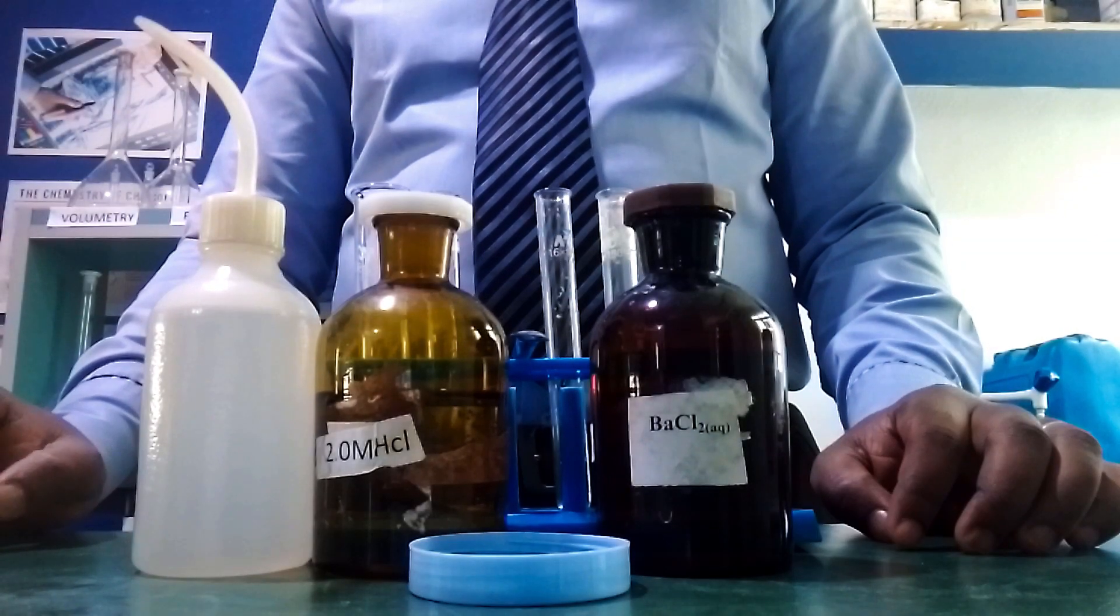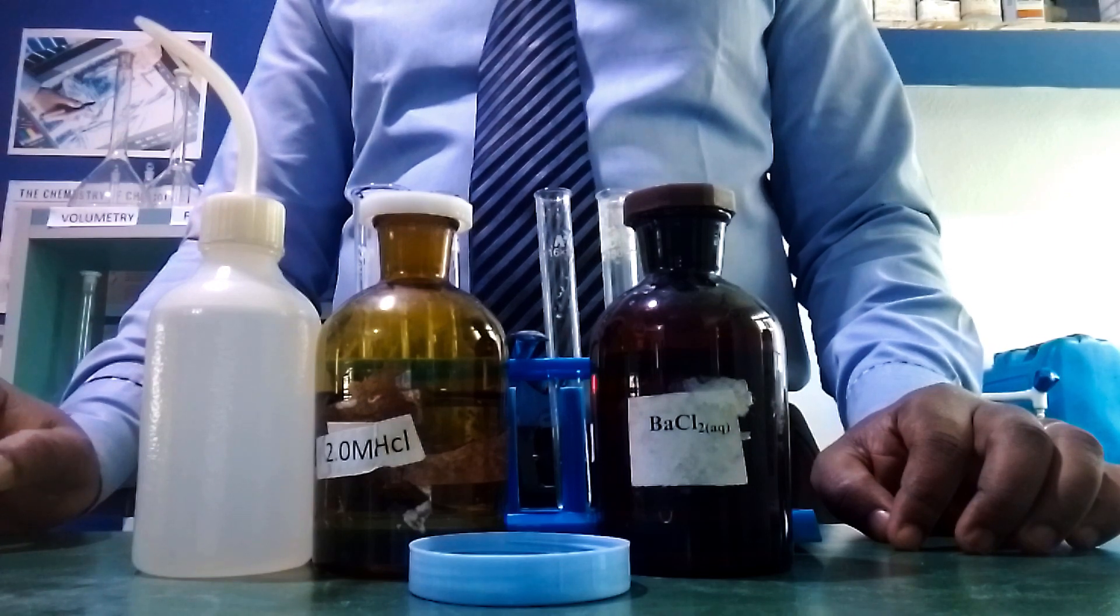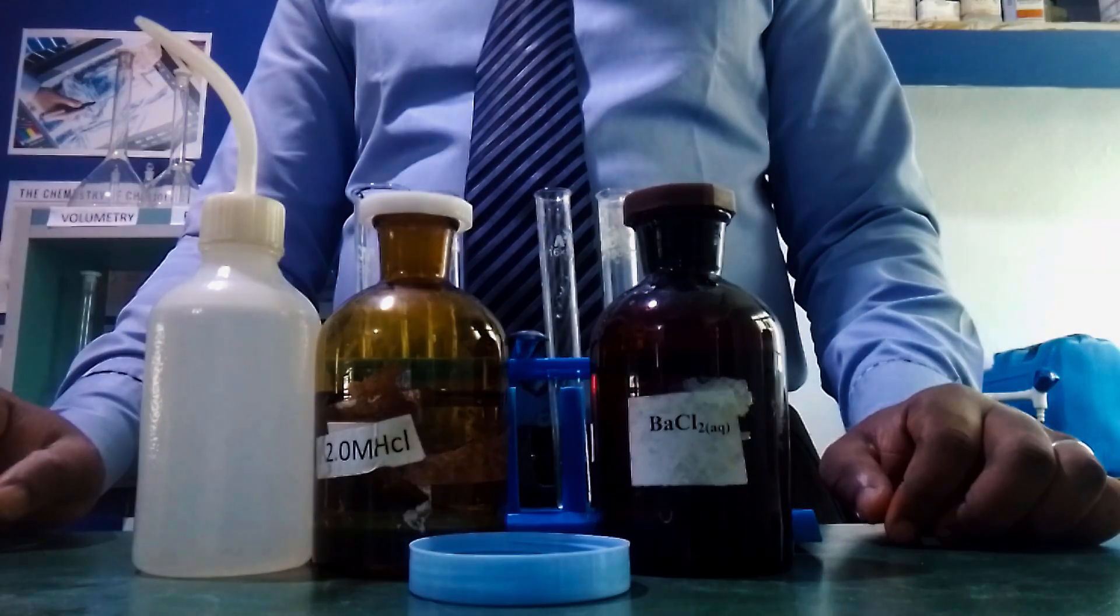Hi, this is the Science Chef. In this video, I'm showing you how to carry out the experiment for the qualitative analysis in the 2023 NECO Chemistry practical. Let's start.